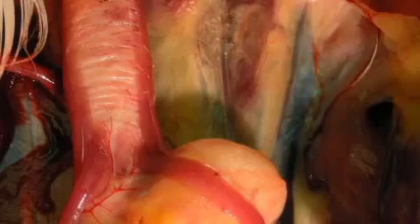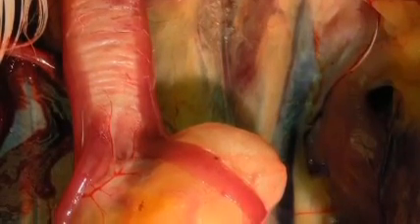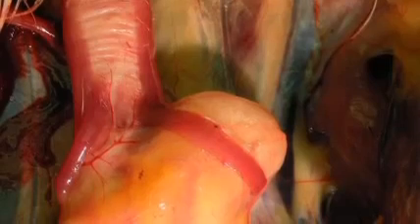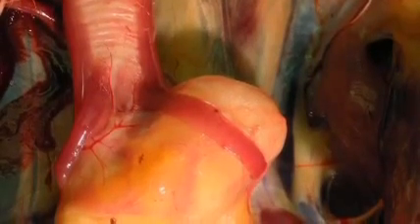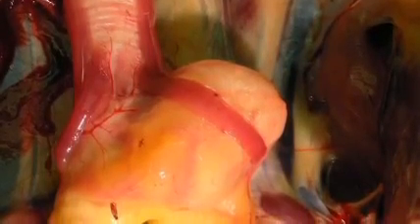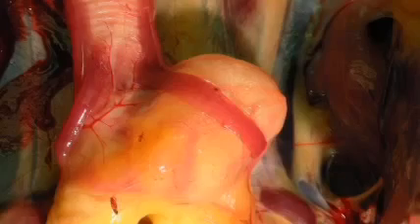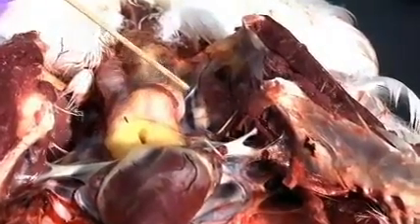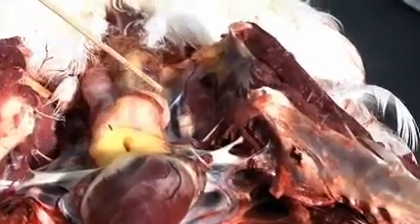Examine the trachea and syrinx. In the female duck and goose, the syrinx resembles that of the chicken. Male domestic ducks have an asymmetrical bony dilation on the left side of the syrinx, known as the bulla tympaniformis. Vibration through this structure is responsible for the generation of sound.